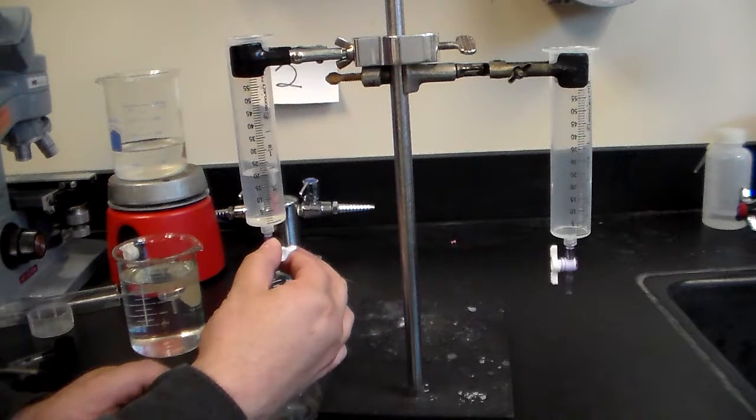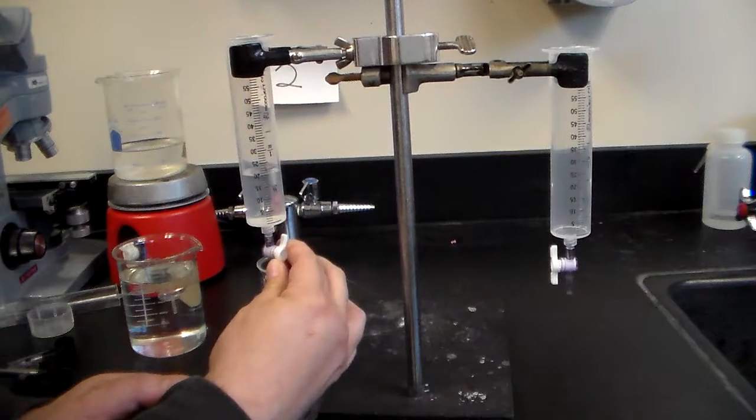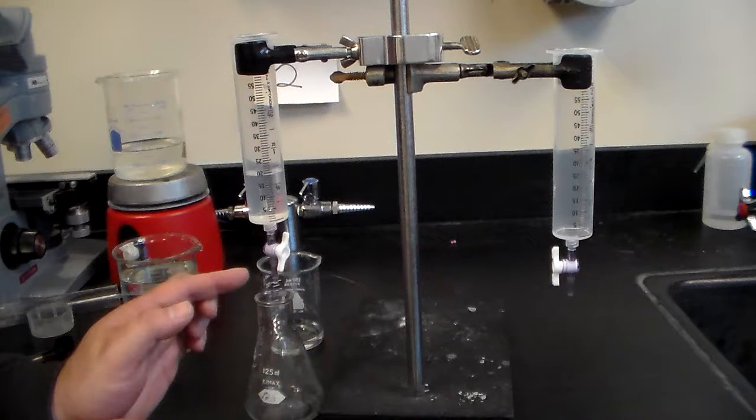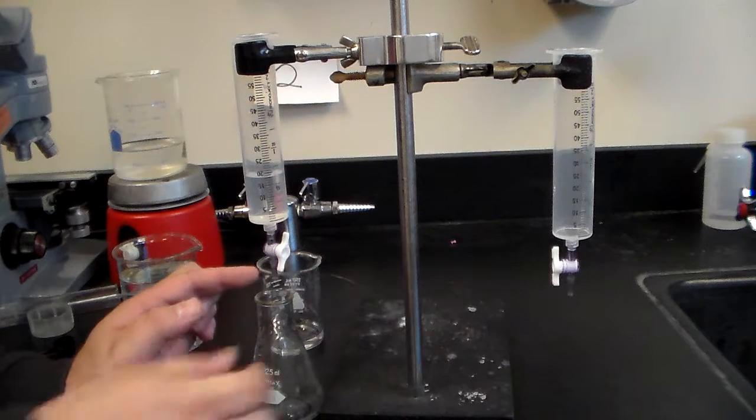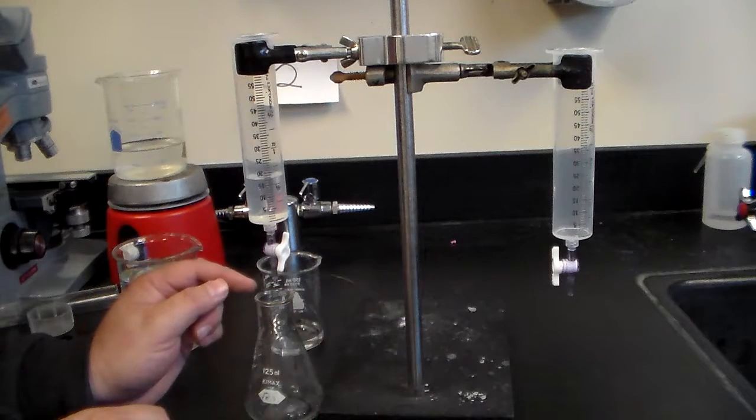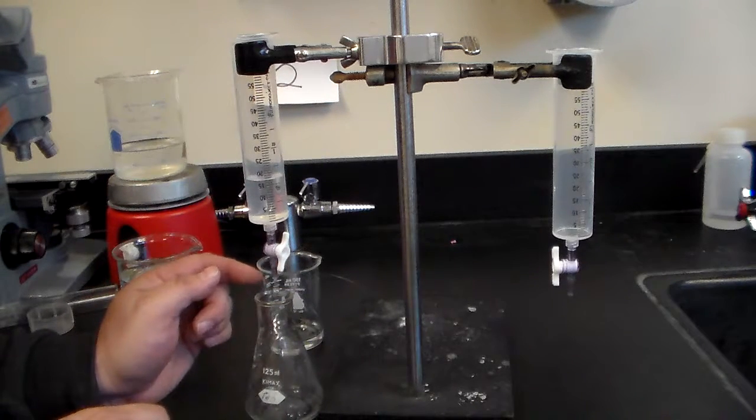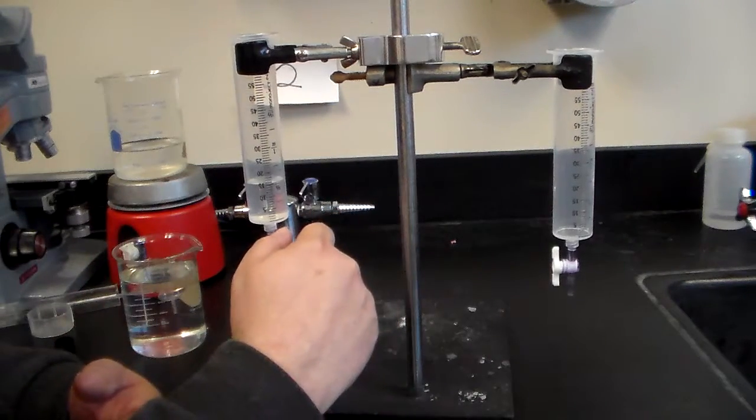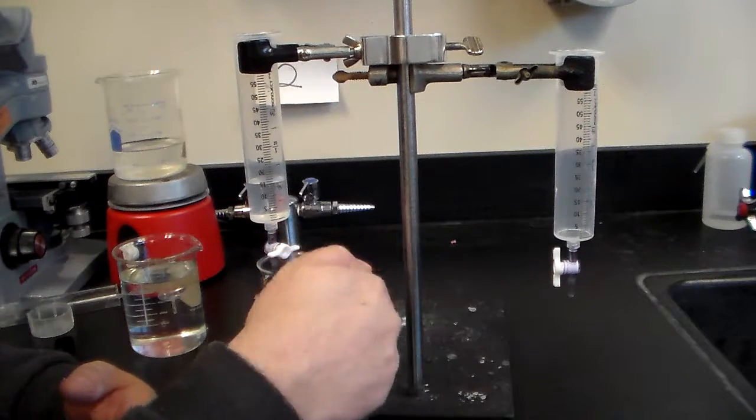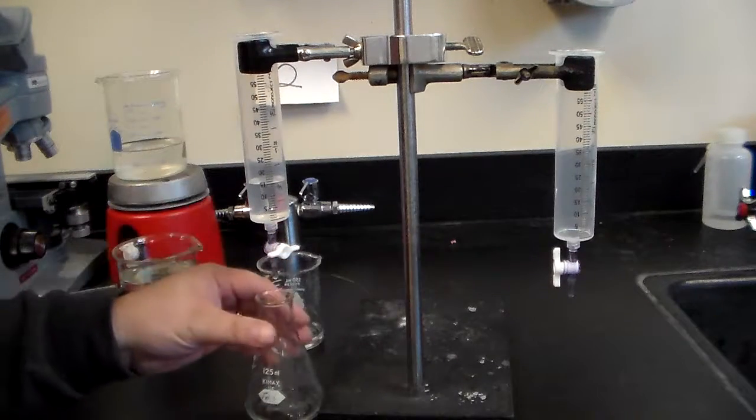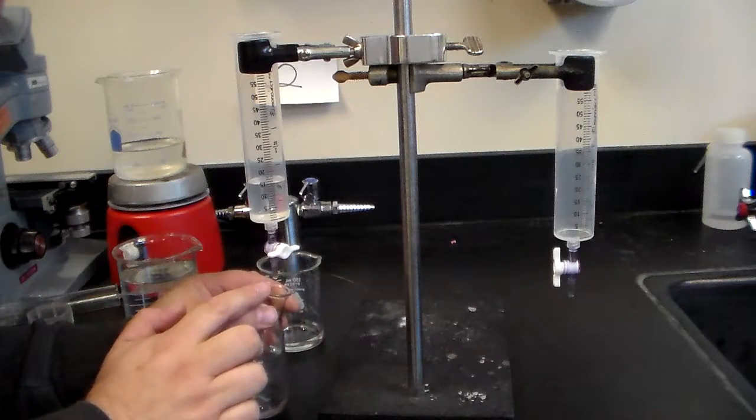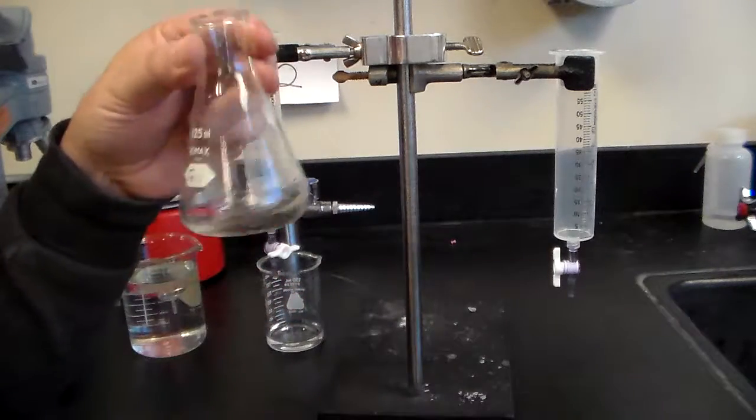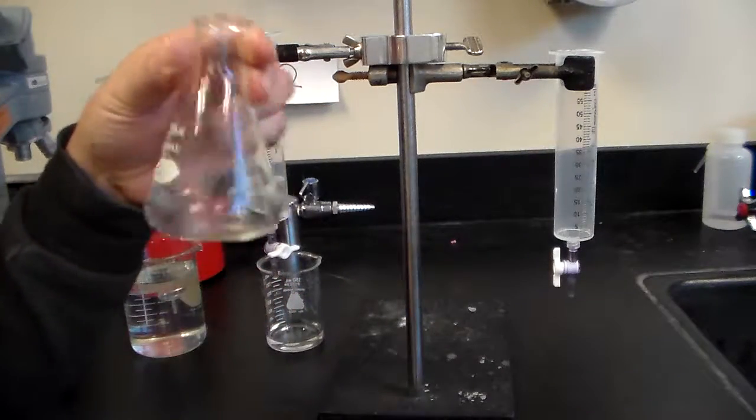If you notice about the burette here, I didn't turn the valve all the way open. But if you take a closer look, you'll notice that there are drops coming out and the burette is slowly draining. We want to get it where we're now at the 15 milliliters, so I put in about five milliliters. You notice there may be a little drop here, we can ignore that. Now you need to swish it around like so, so that everything gets mixed.